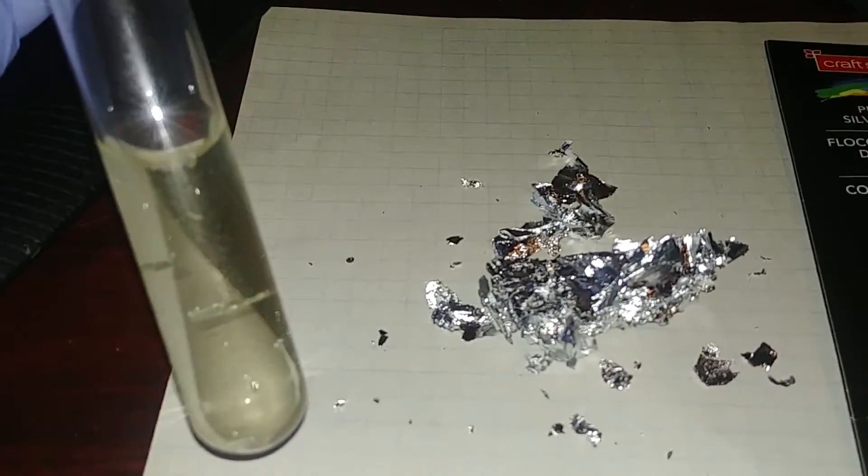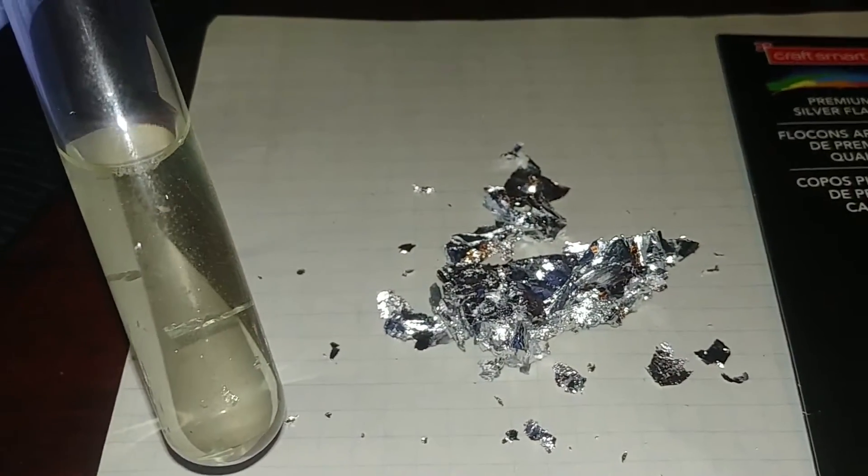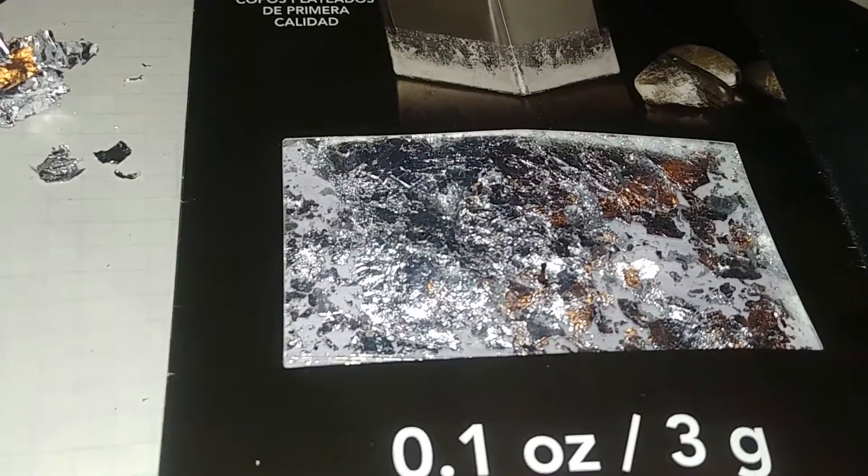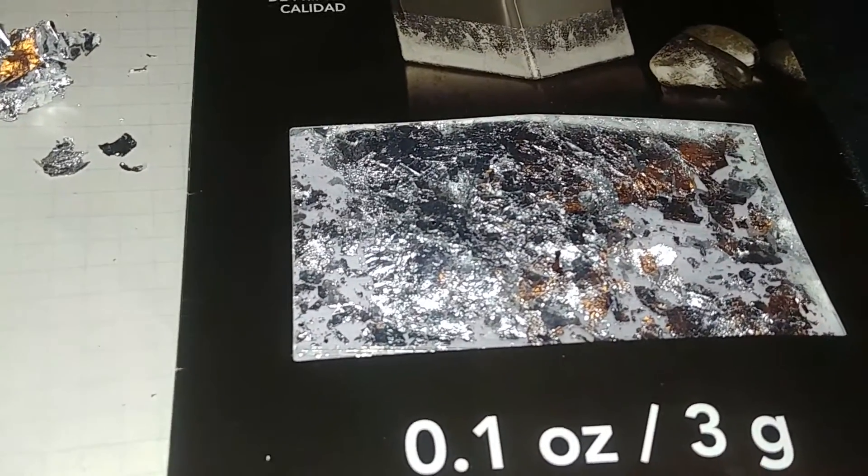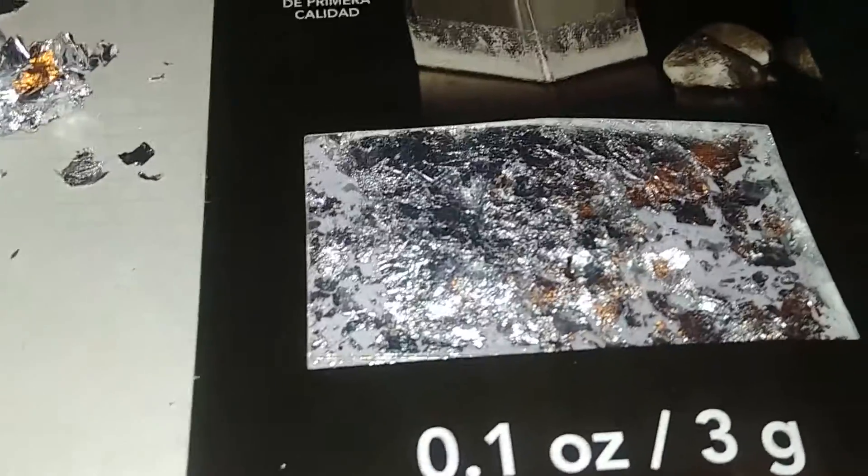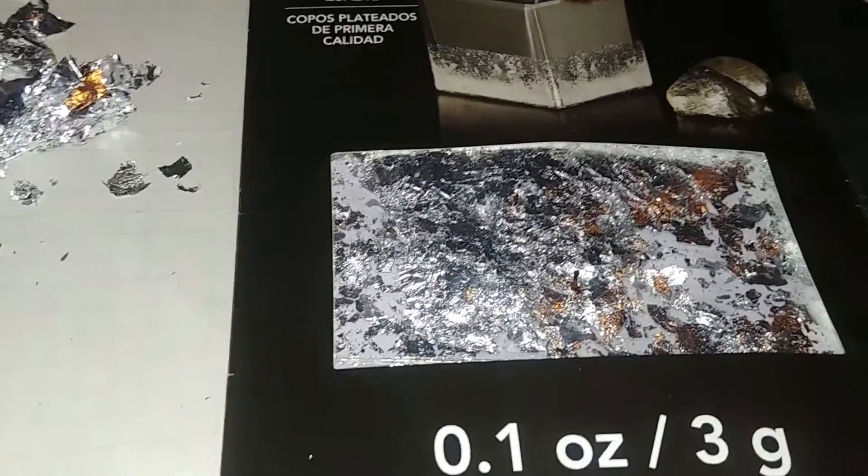But for very small experiments or even if you wanted to do an ounce, this stuff really is not that expensive. This packet was, I believe, $7.99 or $8 at Michael's Arts and Crafts.